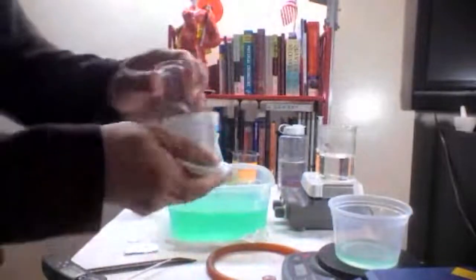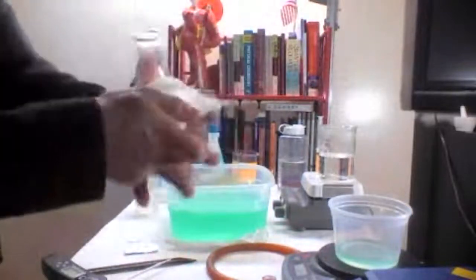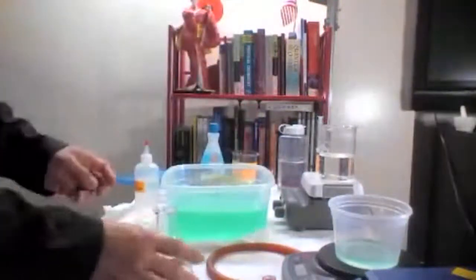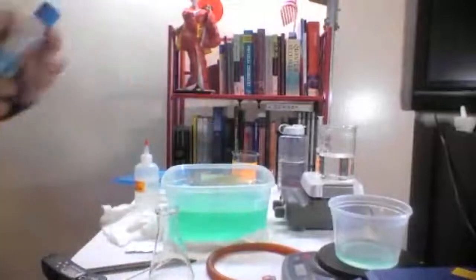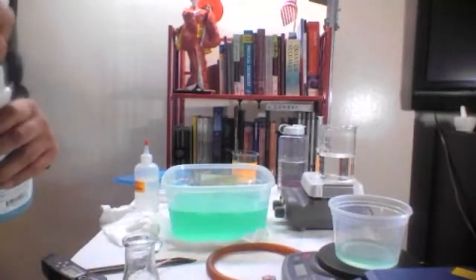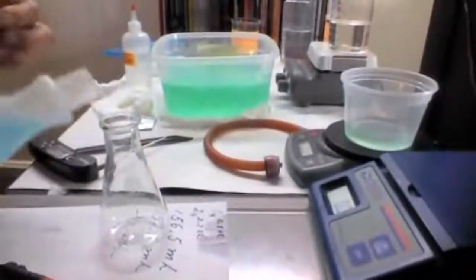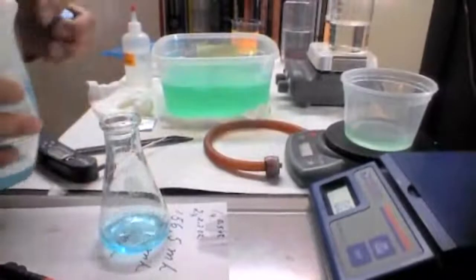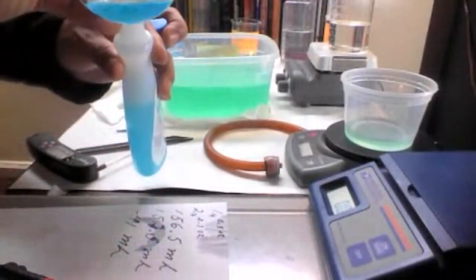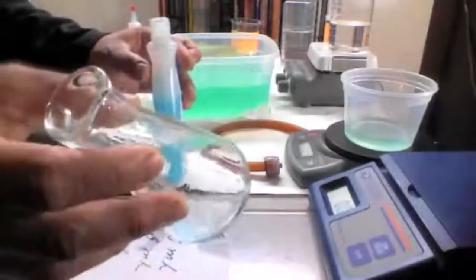Okay, now we have heated up the flask, and all of the liquid that was in there has evaporated, completely empty now. And what we're going to do is put some of this acetone in here. You didn't need that much. Okay, just a small amount of acetone.